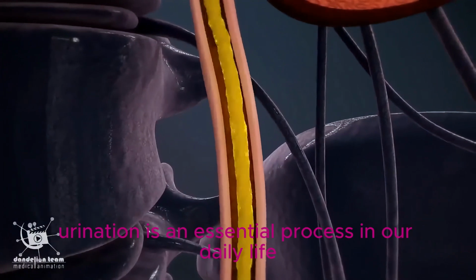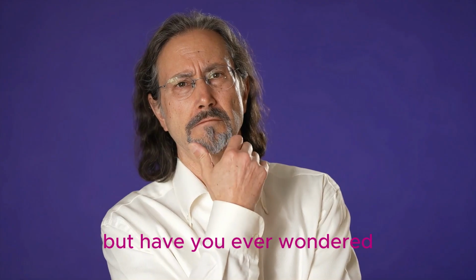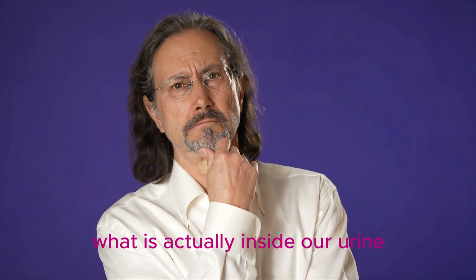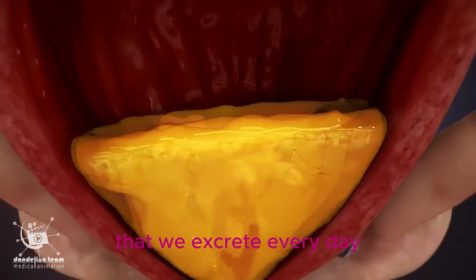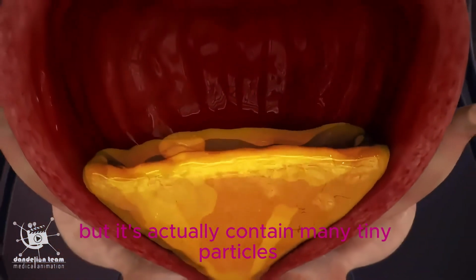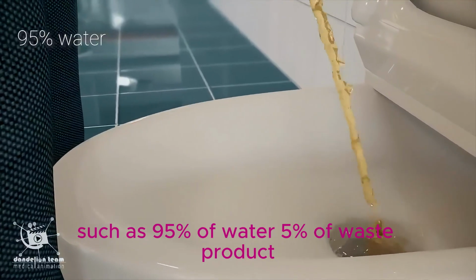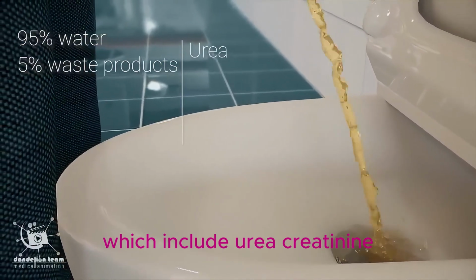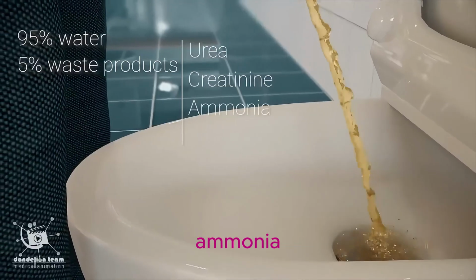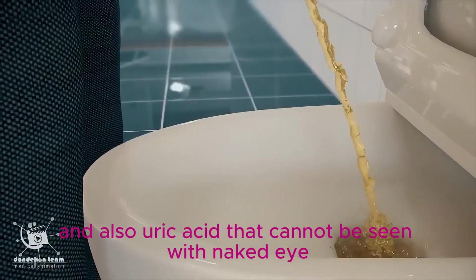Urination is an essential process in our daily life. But have you ever wondered what is actually inside our urine? Urine may be seen as a simple liquid that we excrete every day, but it actually contains many tiny particles, such as 95% of water, 5% of waste product, which include urea, creatinine, ammonia, and also uric acid that cannot be seen with naked eye.